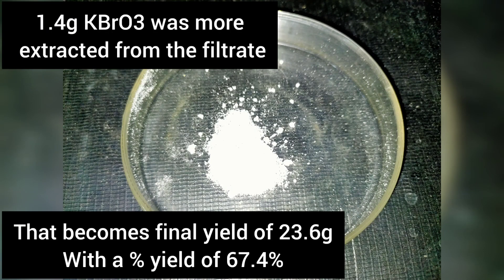That become the total of 23.6 grams. That corresponds to a percentage yield of 67.4%.